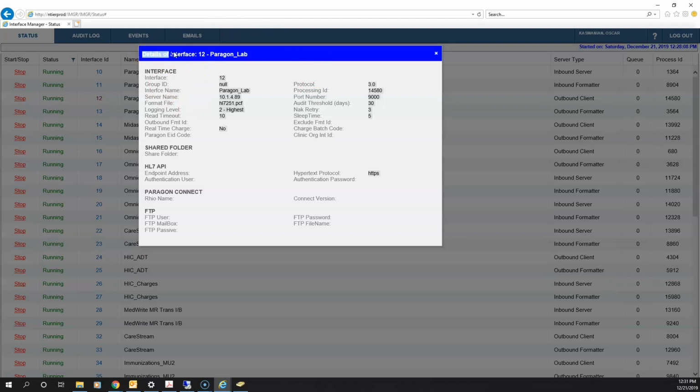So obviously, details for the interface. This one tells me that the interface ID is 12. The protocol and the port number are going to be important. It's sending over port number 9000. And then the server IP is here. So the second or third step, I suppose, to troubleshooting is to see if we can communicate with this IP.